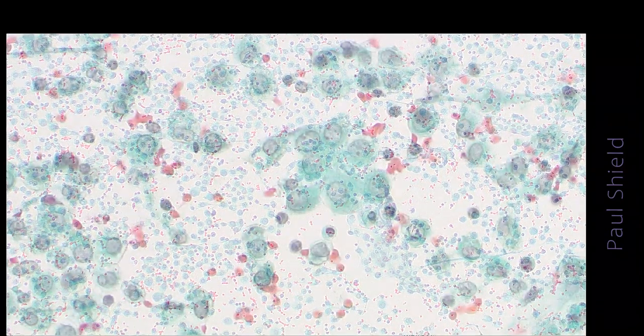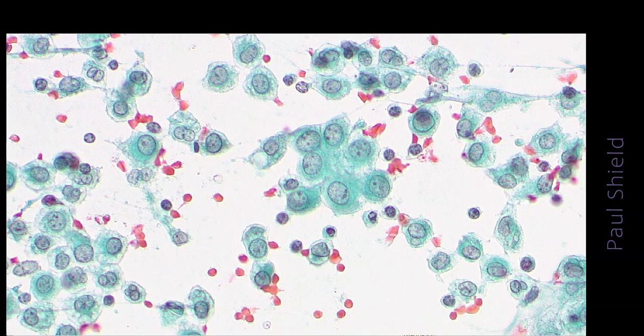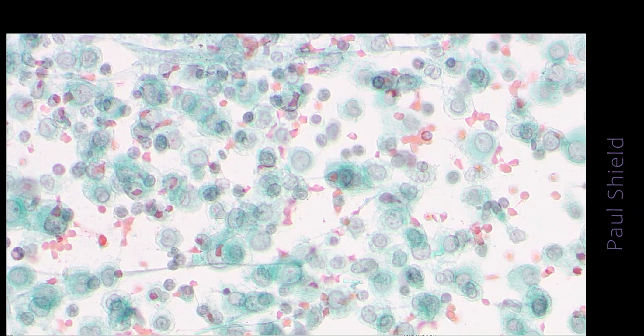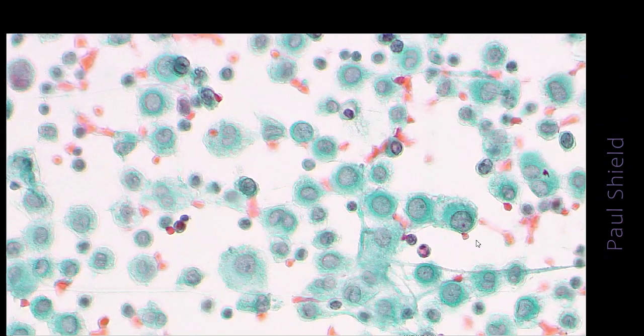This is the pap stain. You can see it's very cellular, lots of mesothelial cells and some little groups. But even at this power, you can see how pale the nuclei are, so they're just not standing out from the cytoplasm. They've got prominent nucleoli, but they're quite identifiable as definitely mesothelial cells. Just looking around, they've nearly all got lacy collars like this.